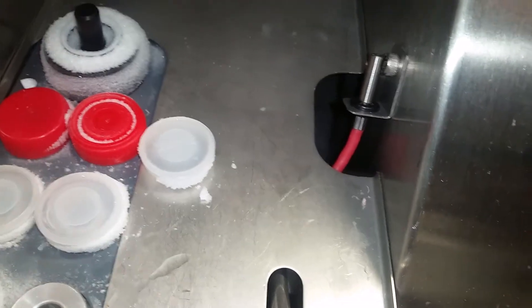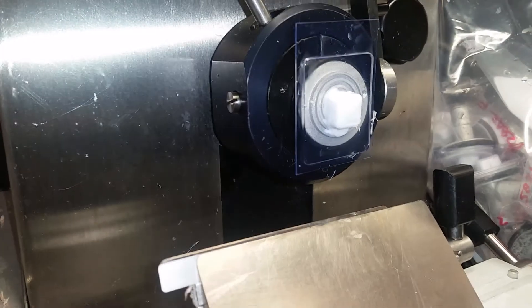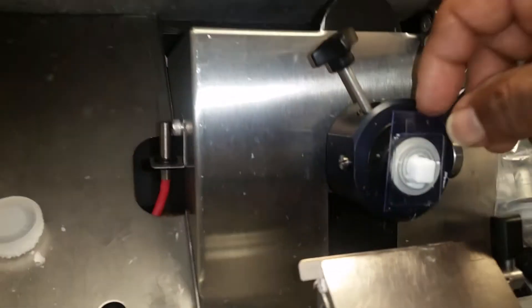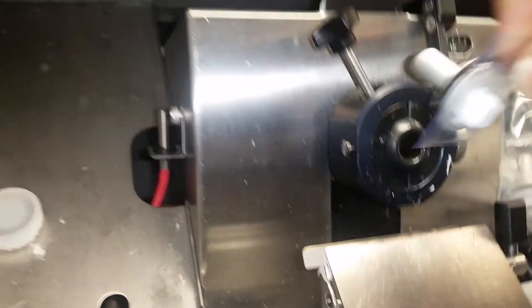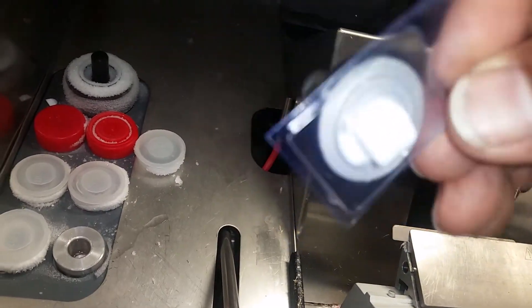It's ready to place inside your cryostat. Now, I should have gloves on, but just to show you — it's ready to cut. You'll pop that off. It's really not connected that well on this dummy block, but just to show you how to connect it.